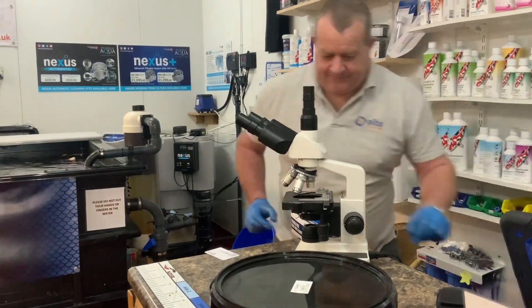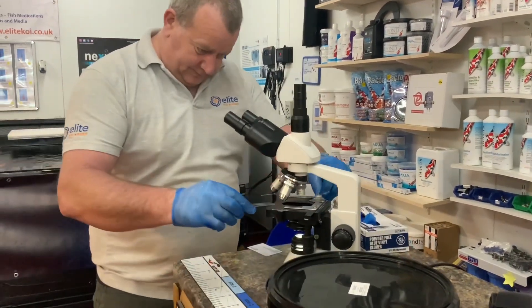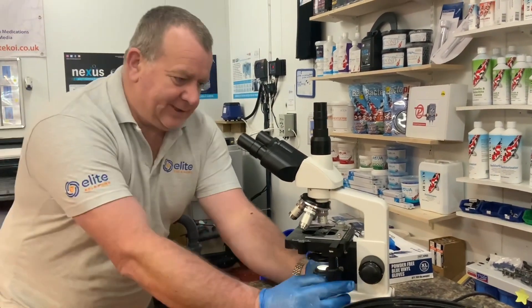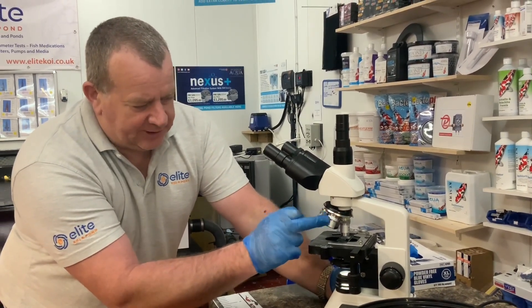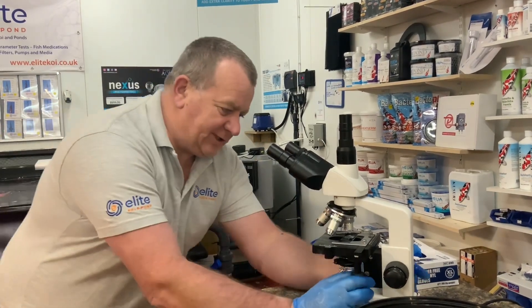Put the slide in, turn the lights on, and put the slide on the mechanical stage. There are four optics on the microscope — we always start with the smallest one, which is four times. Combined with the eyepiece, we're going to be looking at 40 times magnification.